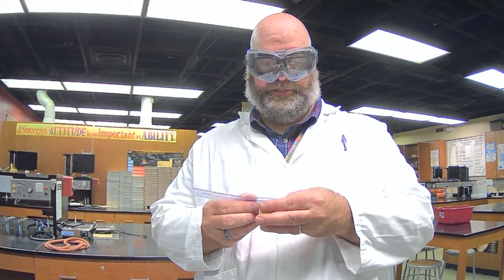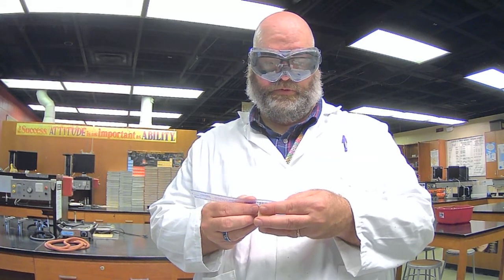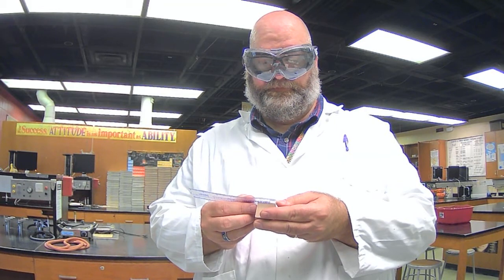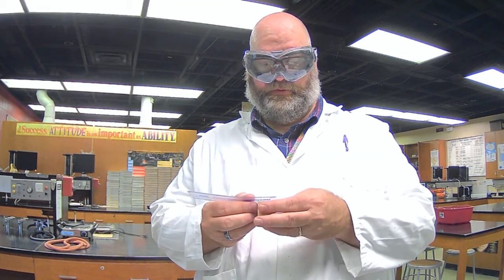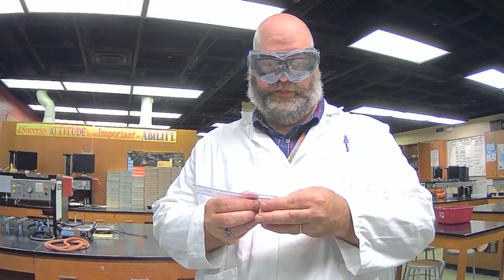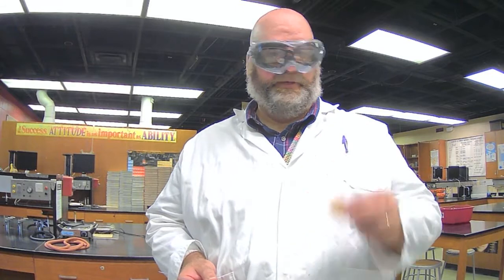Rotate it, the next dimension, 3.00 centimeters, and rotate it again. Let's do it this direction. Got a hard edge. And it is actually 3.00 centimeters. So 3 by 3 by 3. Those are the objects that we're going to measure as solids. So that part of the lab is over. The next thing we're going to do is some liquids.